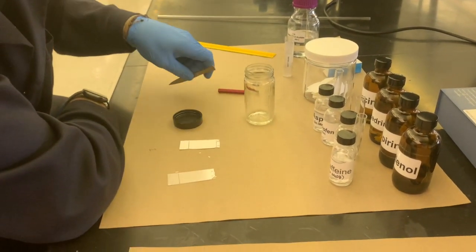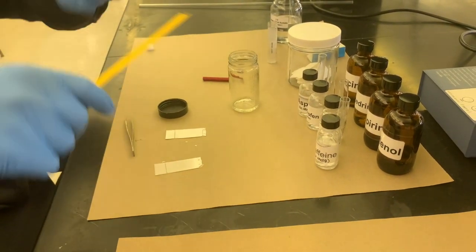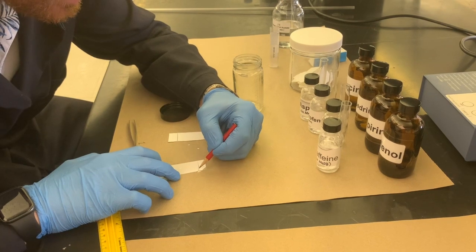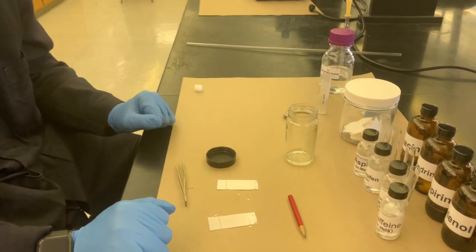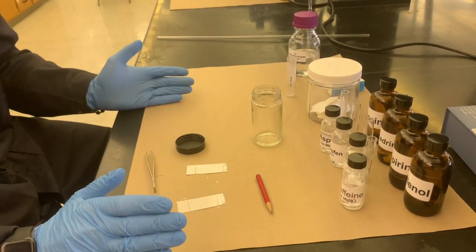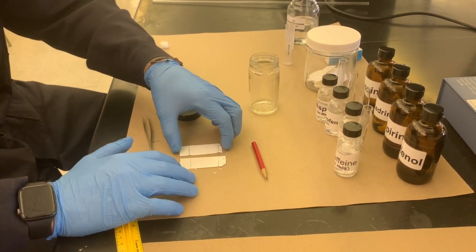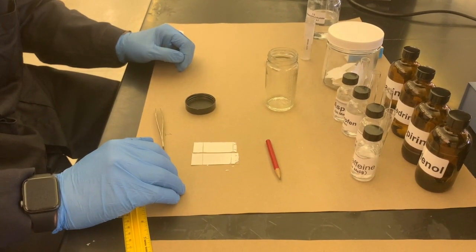So since it's different than the last plate, I'm going to take this ruler or just a pencil and make a line where the solvent line ended. It's important to make sure that you do that while you remember, especially while you're still learning, because you can't expect the endpoint to basically move from where it was supposed to be between these two much compared to the proportion of distance that those individual compounds are traveling.